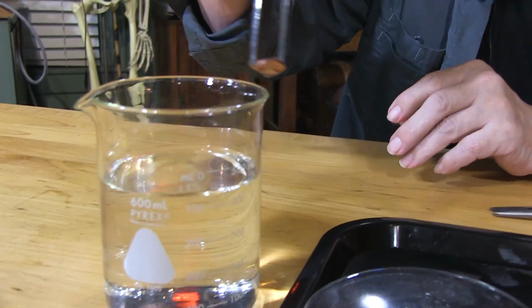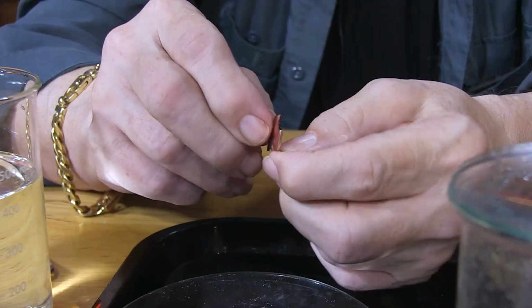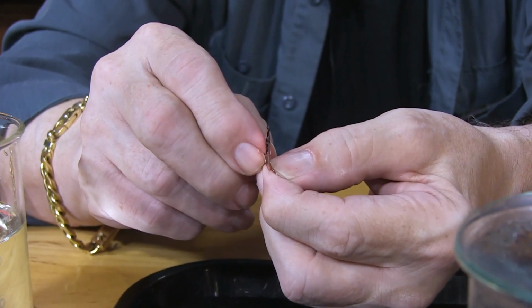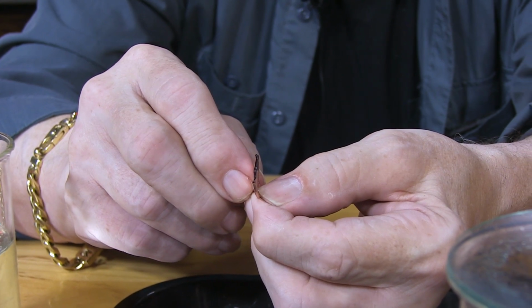Pick that up. Oh, look at that. I almost broke it. Almost broke it in half. Look at this. It's all flimsy. It ate out the zinc. The zinc be gone. The zinc's in solution now. I've ended up with a hollow penny.